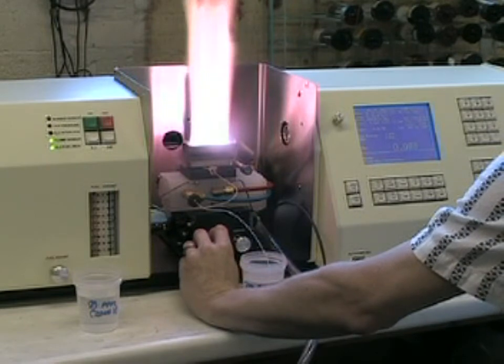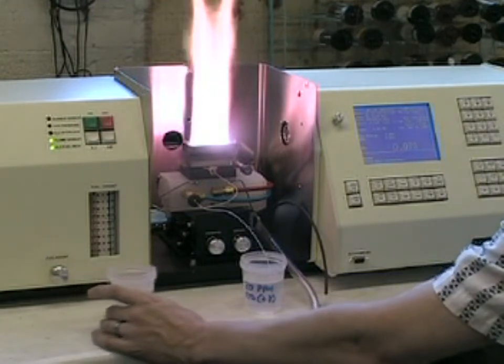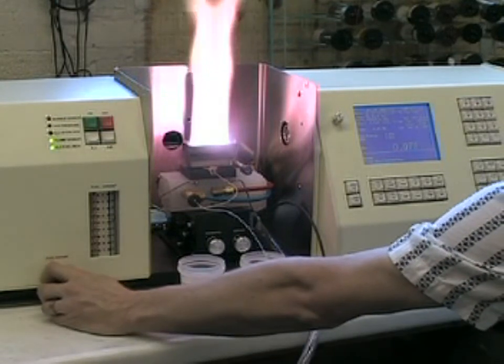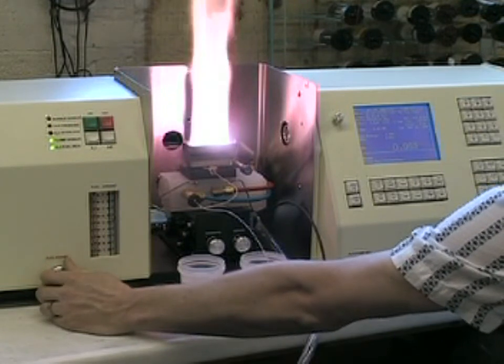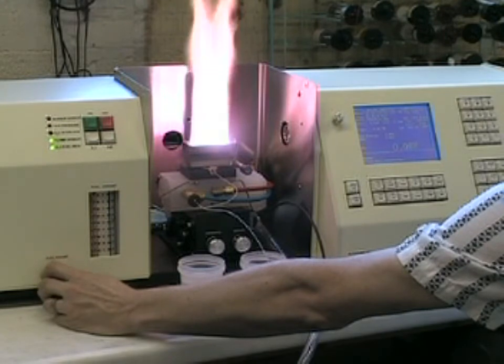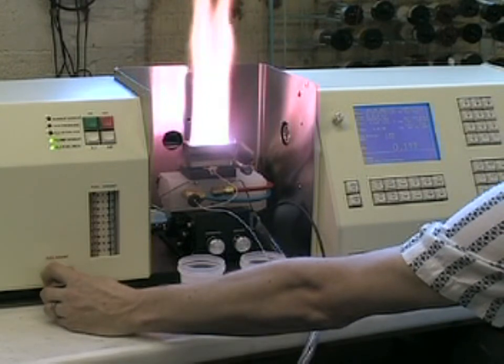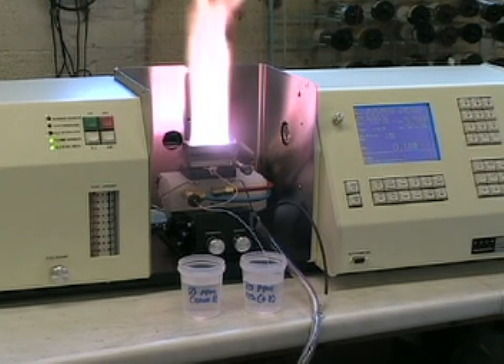Different elements will require different degrees of optimization. So for nitrous oxide work, this is a standard protocol. Sometimes it is necessary to also adjust the fuel even lower or higher as needed to increase our signal. And here we can see we're averaging a 0.1 absorbance for a 20 part per million buffered barium standard, which is excellent.